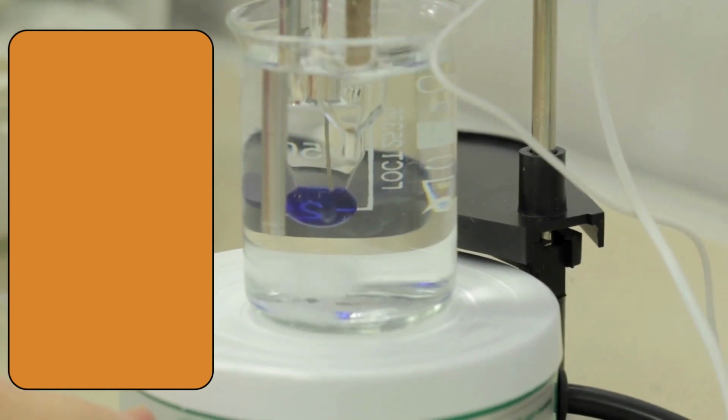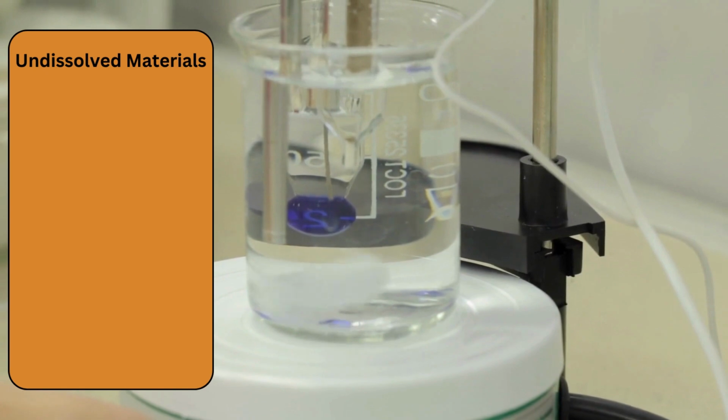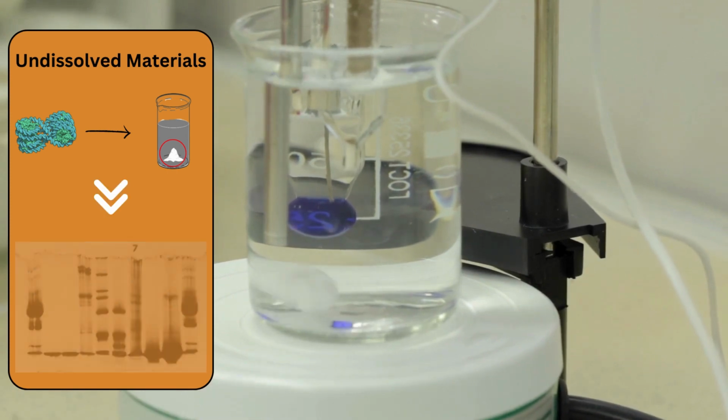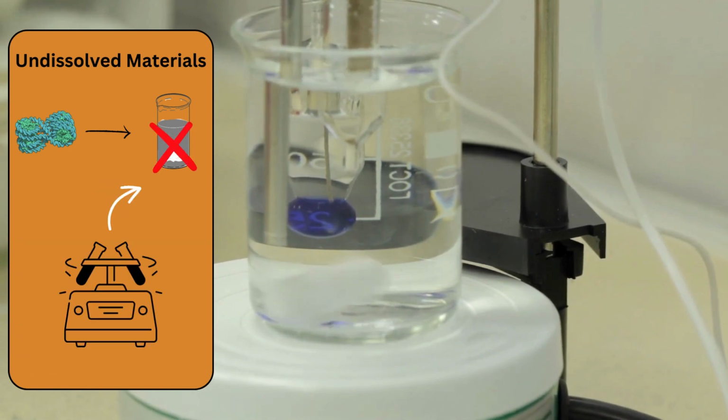This error can be caused by the undissolved material within the SDS sample buffer as well. Some proteins, such as histones, may not completely dissolve in the buffer after heating. If not removed, these undissolved insoluble materials will cause streaking within the polyacrylamide gel. To troubleshoot this, insoluble material can be removed from the sample by centrifugation before loading into the wells of the gel.